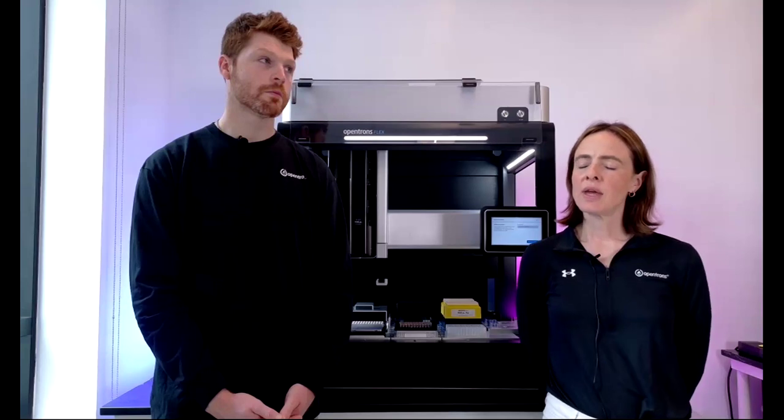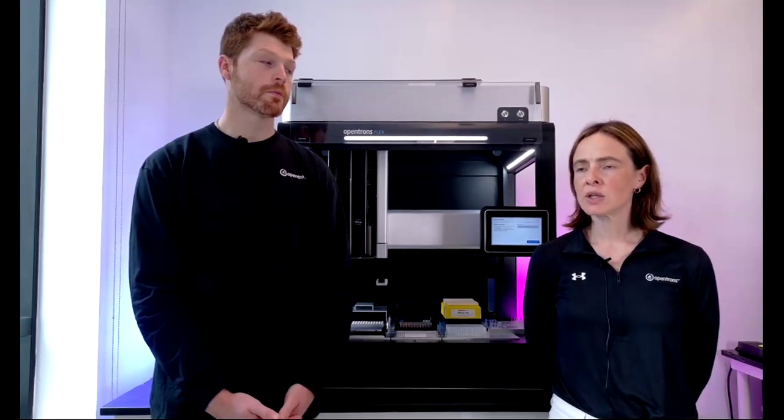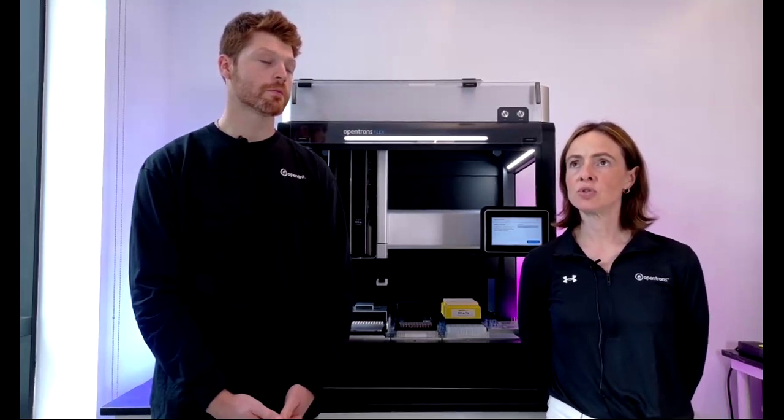Okay. A few questions regarding Flex. Is there a low volume limit working with 200 microliter pipette tips while writing protocols with a designer? Actually, let's answer that first one first. Is there a low volume limit with 200 microliter pipette tips? There is, and I'm struggling to remember what it is. We do recommend that if you are, for example, working in the 1 microliter range, that you use the lower tip volume.